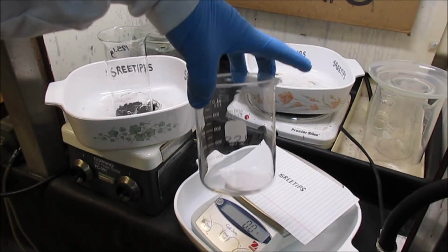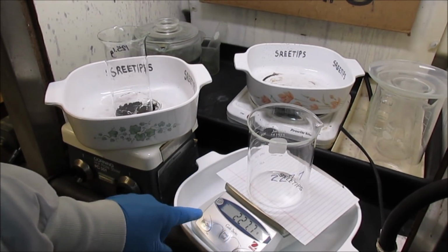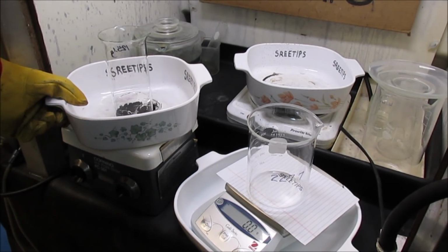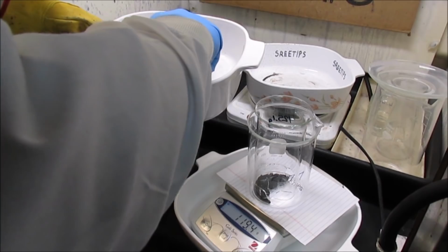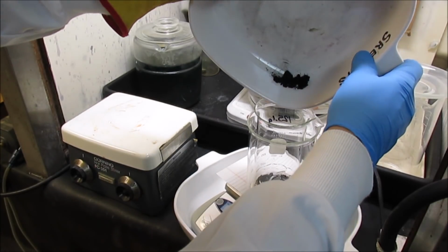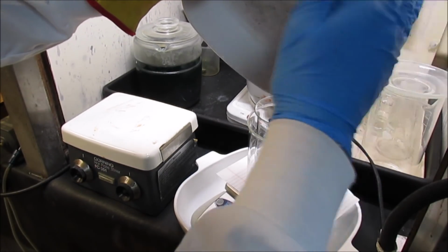I've got another beaker here that I've written the weight on. It's 227.7 grams. And we'll tare the scale on that one. And then now we'll take the pieces of this broken beaker and transfer the entire contents into this, and that should give us the weight that we're looking for on the mixed PGM powders. Just going to put everything right on in there. Luckily I had a clean dish here, so all I've got to do is transfer the stuff out of here into my new container, and I should be able to get a decent weight here.